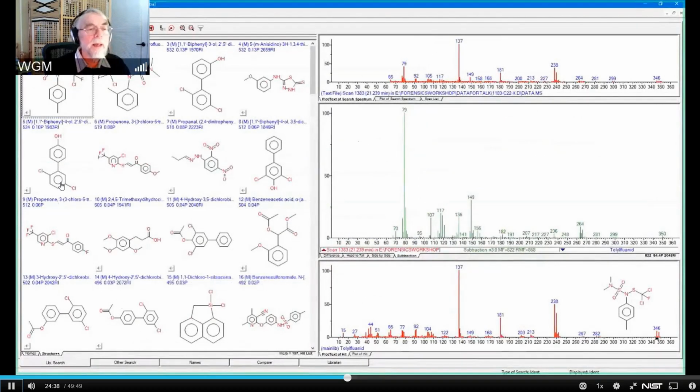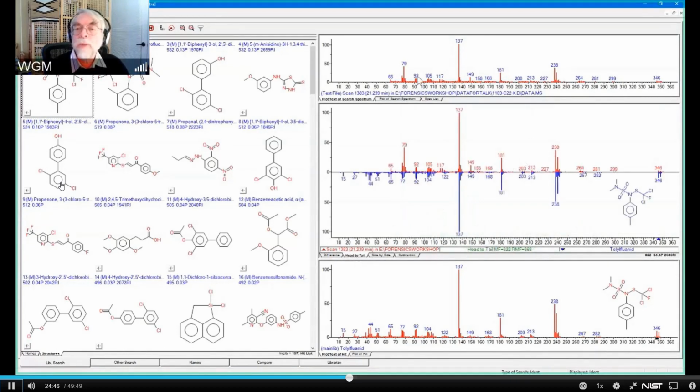And what I got was exactly what I'd already shown you. Here is what it looks like head to tail. Here is the unknown, which is just that single scan. Here is the best match. And you can again see that there are peaks that aren't matched at all, and peaks that are matched very poorly. So the question really is, what's the next step? I've already discussed the next step, but I wanted to show it to you in real time, and that is that I simply go to subtraction here.